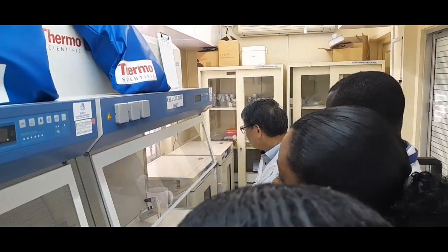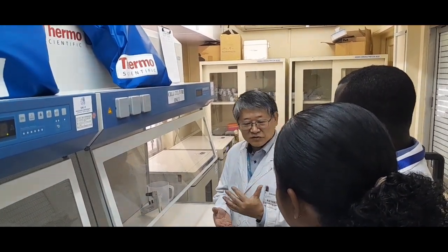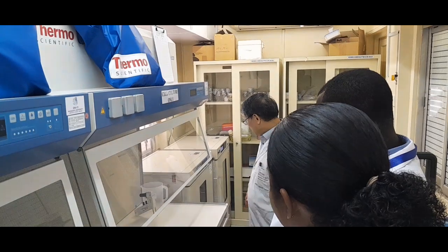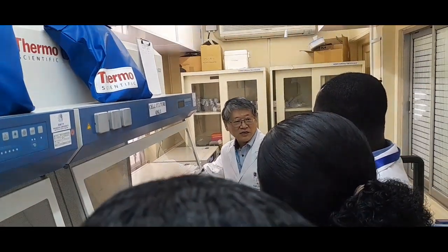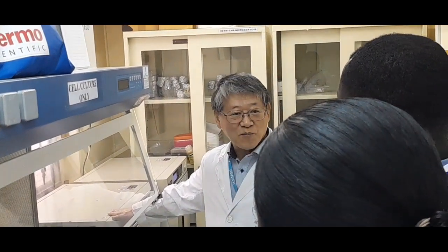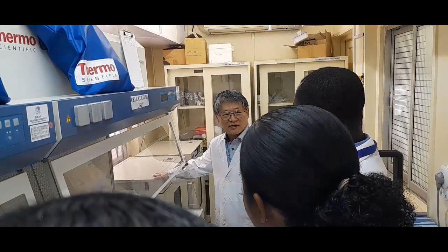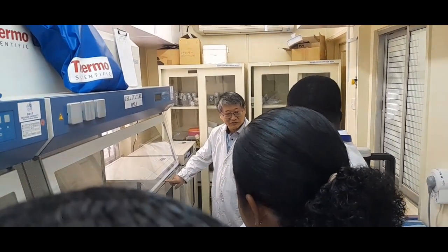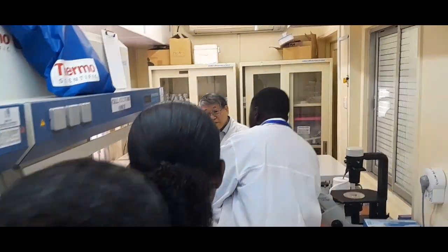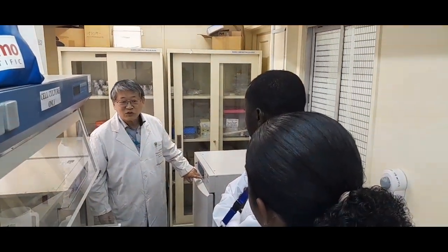As you know, for cell culture we usually use mammalian cells at 37 degrees Celsius, and we are also doing arbovirus research. Arbovirus means arthropod-borne virus, so insects or other tiny creatures, like ticks. In that case we use an incubator at 28 degrees Celsius, a relatively low temperature. And we also have one at 37 degrees Celsius with 5% CO2 gas.